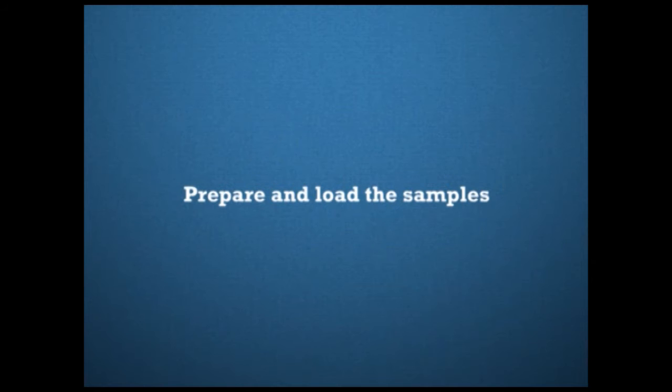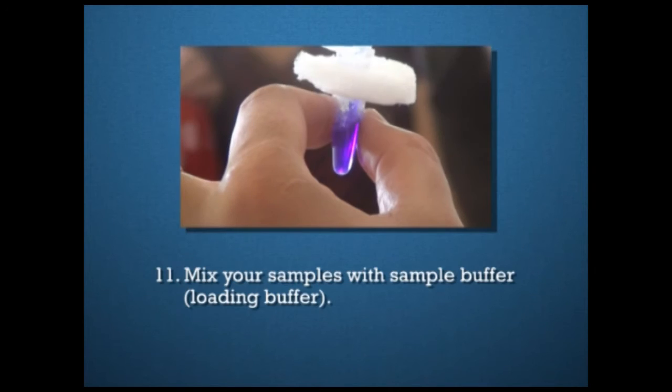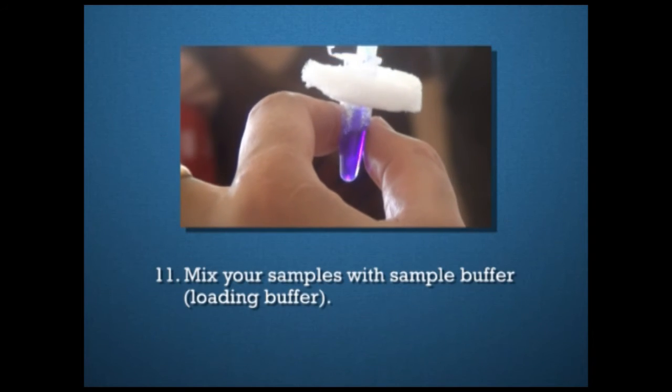In the next step of SDS-PAGE electrophoresis, we have preparation and loading of the samples. Mix your sample with sample buffer, that is the loading buffer.